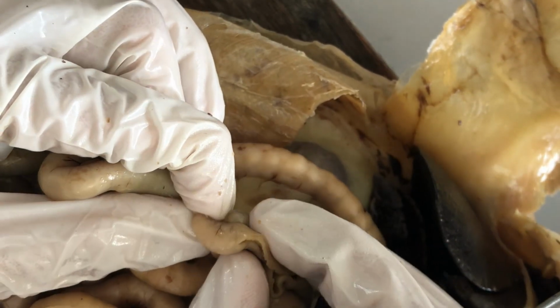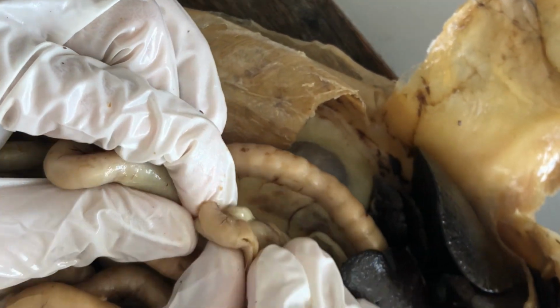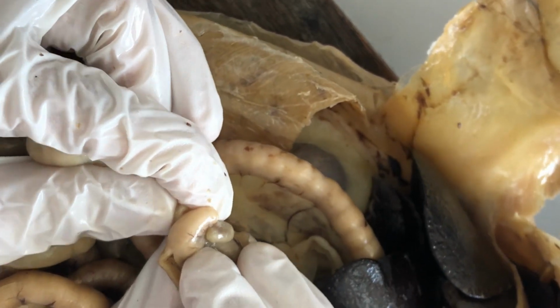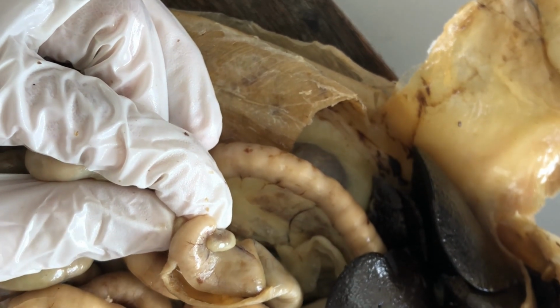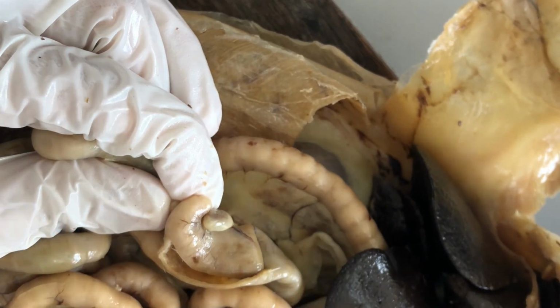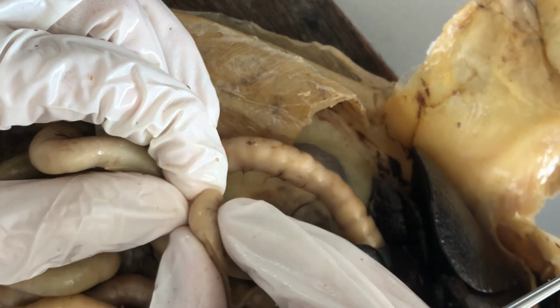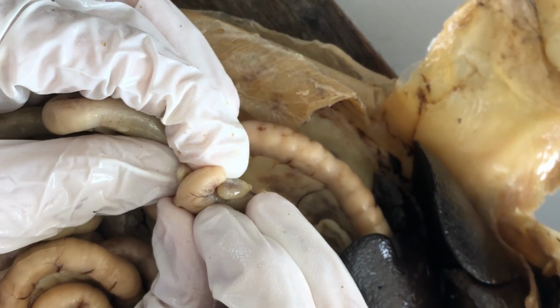Because animals in general do not secrete cellulase or enzymes that can break down the fibrous material of plants. But the bacteria contained inside the cecum will help us extract some of the nutrients present in those fibrous material, aiding in further adding to the nutritional value of the food. But as you know, the cat is not a vegetarian, it's a carnivore. So its cecum is rather small, but that's a blind pouch there. That's the cecum of the cat.